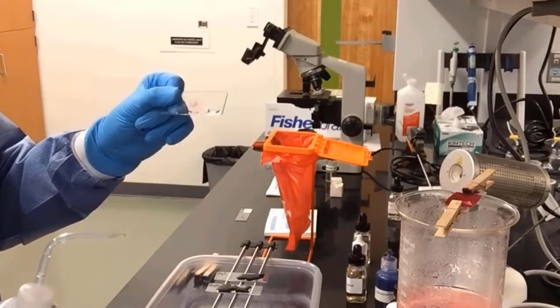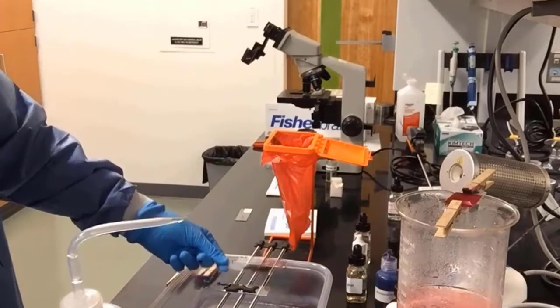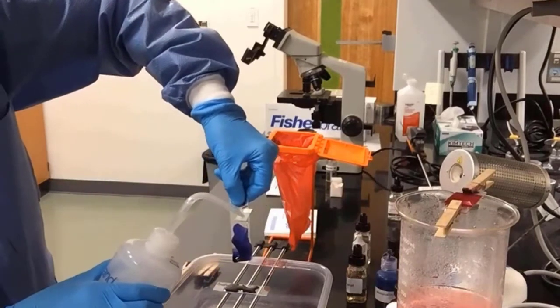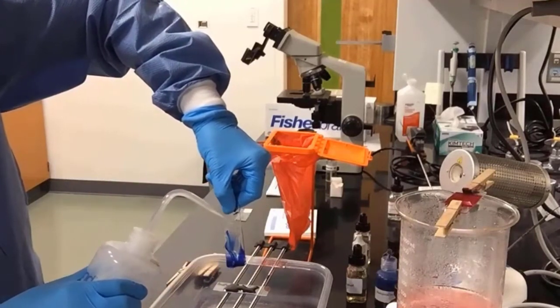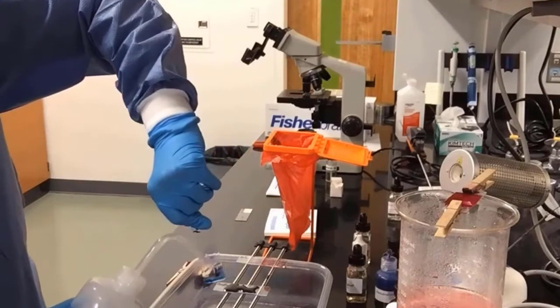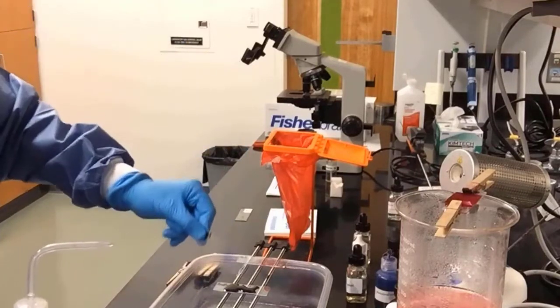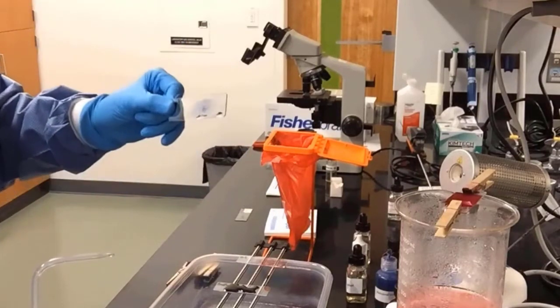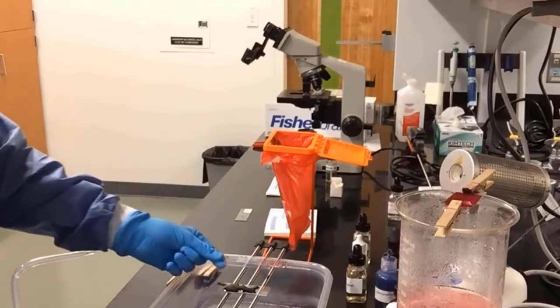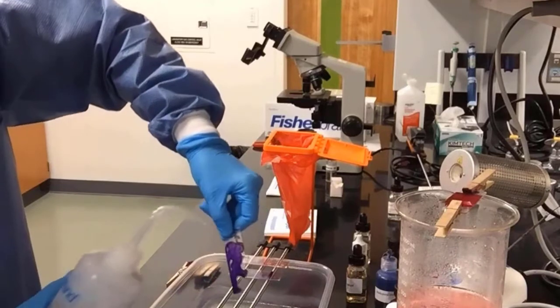The specimen is still on there, the smear, so that's good. Again, we cover the label and we spray the water, let it run down the slide, clean the excess stain. Here we clean it on the back, and you can see it's nice and clean. We check our smear, and our smear is still on there, and it is blue from the methylene blue, so that's great. Our third slide, same procedure.